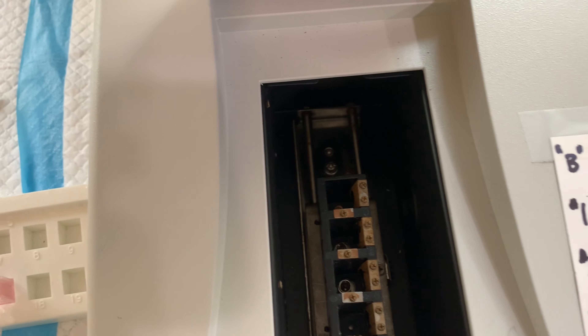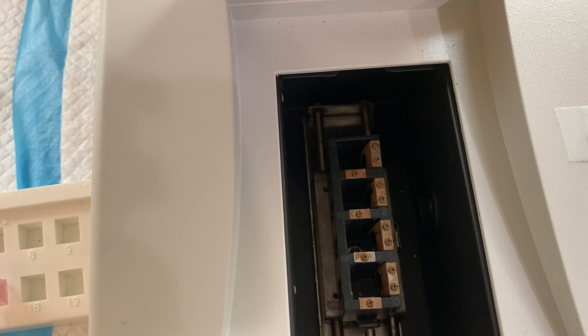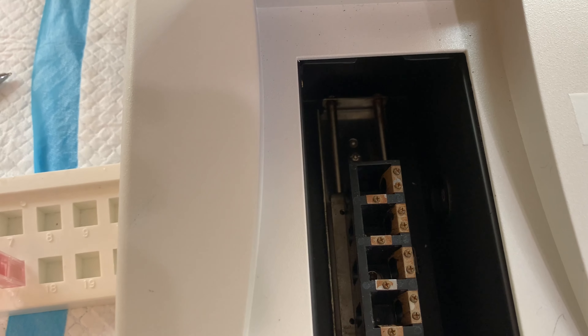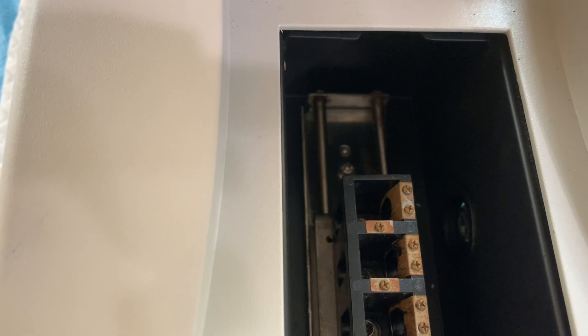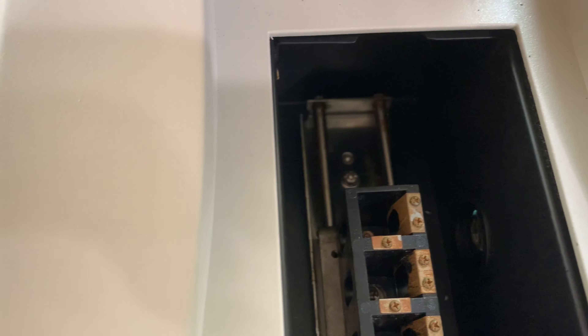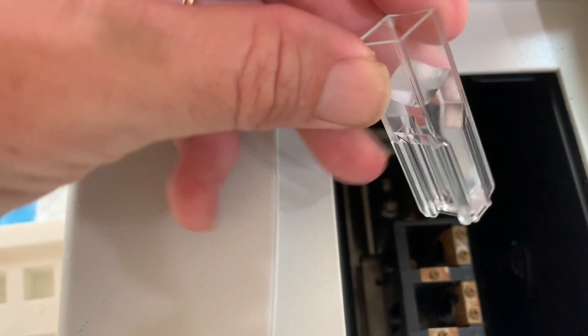The first thing you need to know about a spectrophotometer is you need a place to put the samples. Right here is a sliding spec cuvette holder — it holds four spectrophotometer cuvettes. There's a little output for the radiation; the light beams through these spec cuvettes, and the detector over here picks up the amount of light that gets transmitted through the solution.